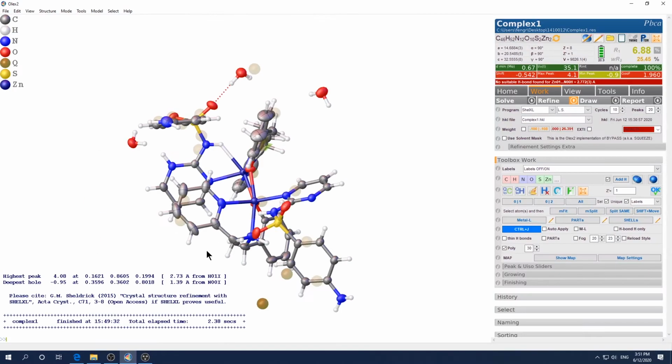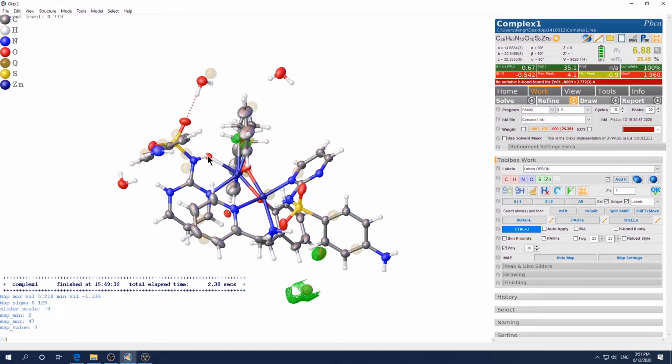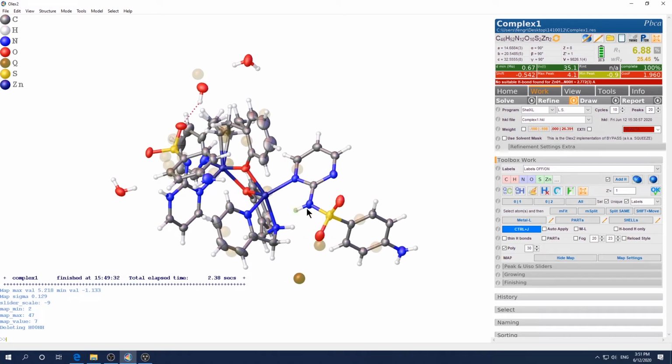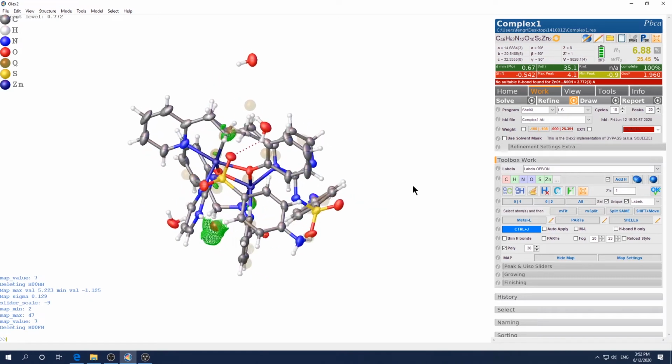Okay, let's see. So that's the beauty of this map. If you bring it up, you can see clearly there's an electron hole here. This hydrogen bond should not exist here. So first remove the map. Click, delete. Similarly, I think the other way, yeah, this one also should be removed. Let's try and double check if that is an electron map, whether it shows a hole or not. It did not show as a hole, but I think the drawing level was too high. But anyway, we know this by chemistry knowledge. We know it's not there. So we remove that one, and also we want to make a correction here.